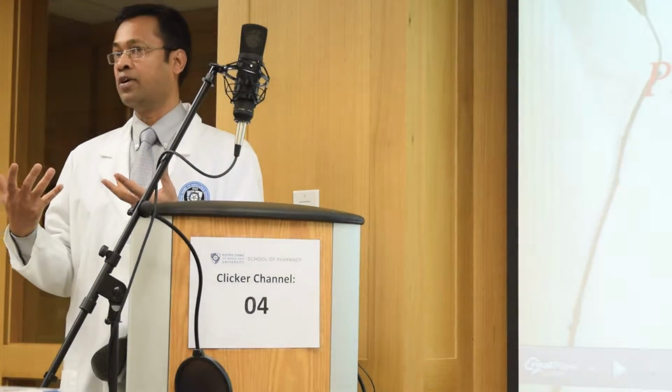In our case, we have camphor and menthol, and when we mix them together, they will form a eutectic. You have to forcefully mix the two things in order to form a eutectic. Now, what is the use of forming a eutectic mixture, especially for ingredients like camphor and menthol, which have a very hard crystalline structure?